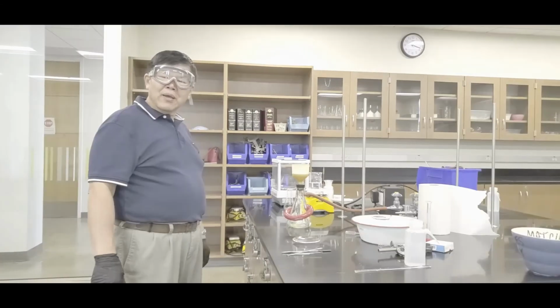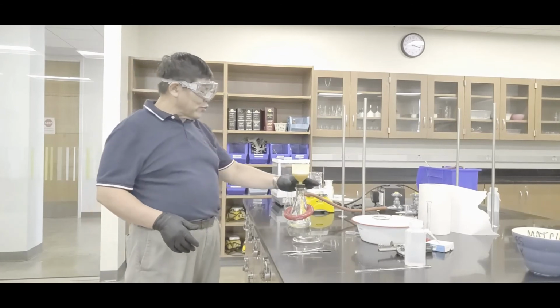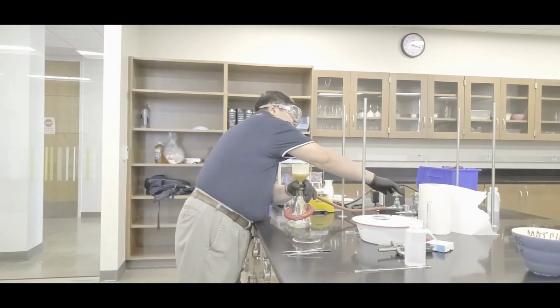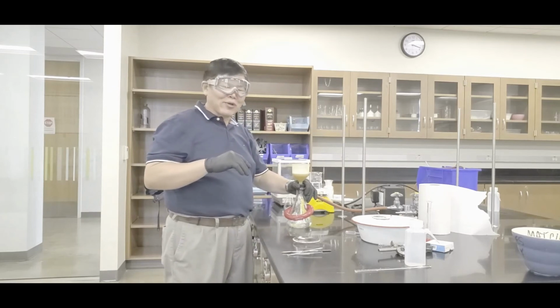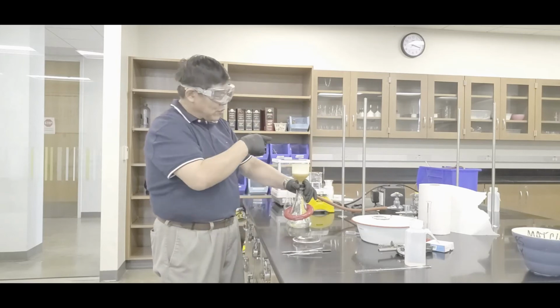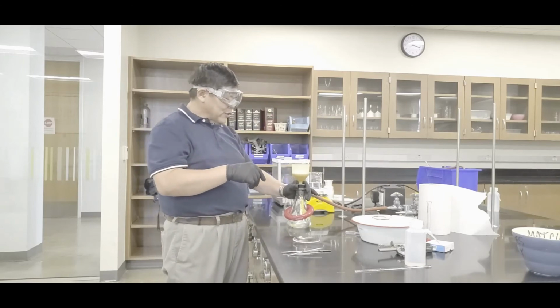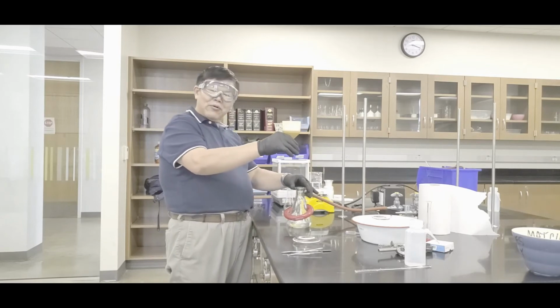Okay. All right, class, we just finished drying the stuff. So in that case, what you want to do is hold on to the flask and then shut the valve, okay? Hey, you guys, make sure you do, because if we run this thing, we're gonna burn the pump. So therefore, shut the vacuum. Now the next thing you can do is this. That'll allow you to pull this thing out.